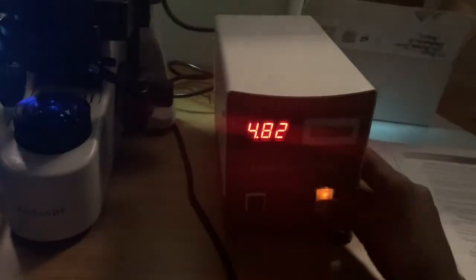Everything. You can simply turn off the box right here. Let's shut down. Make sure everything you used is off, including this main light right here. Obviously you use the switch. Once everything's off, you can just close the computer. And you are done. This was a very basic video explaining how to use a fluorescent microscope.